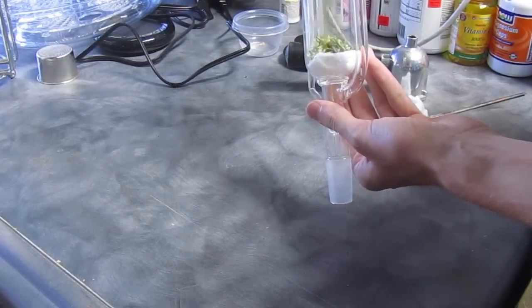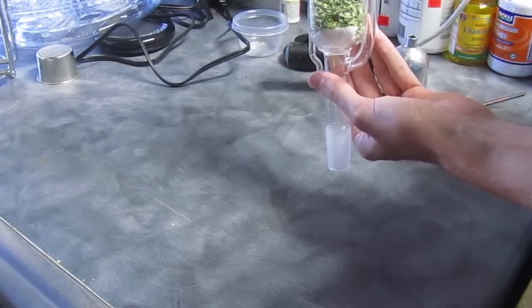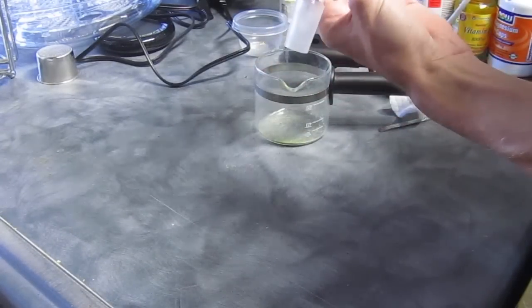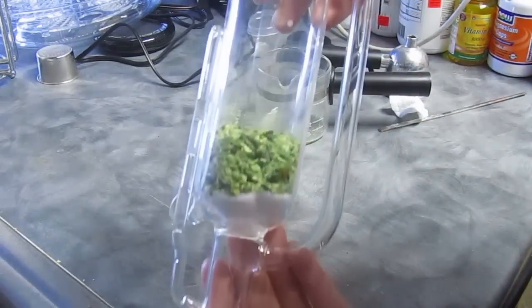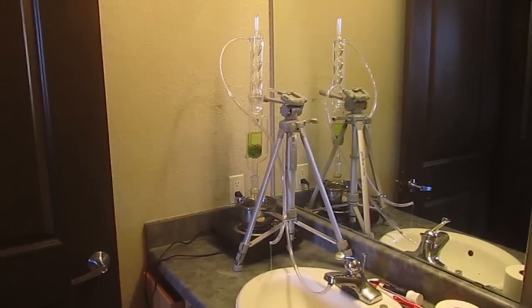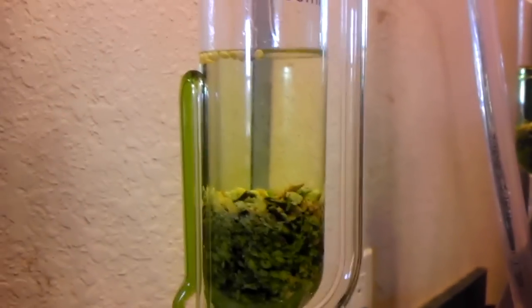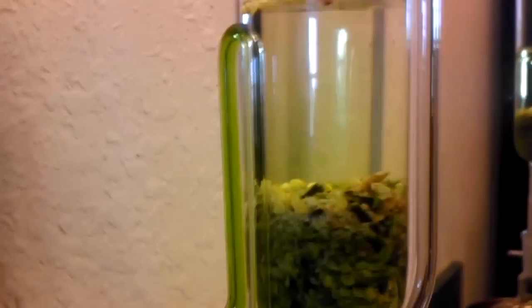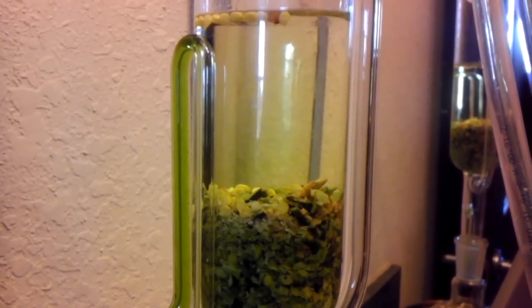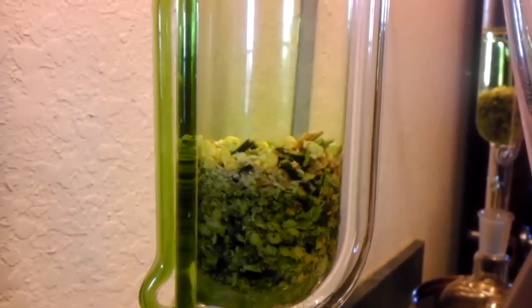Loading it is important. Here's my setup — I have cold water coming in from the sink and returning into the sink, on a hot water bath. It's completely autonomous. Here we go — it's about to cycle through. This is probably about halfway through the extraction. You can see that the liquid's getting a little bit yellowish, and by this time about all of the capsaicin was extracted. I stopped it shortly after this.